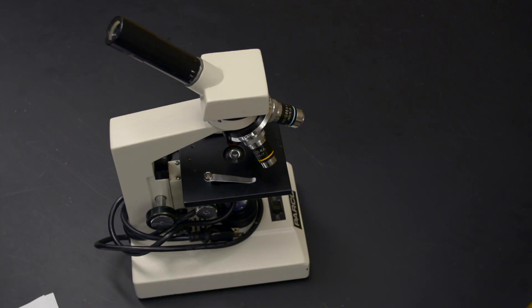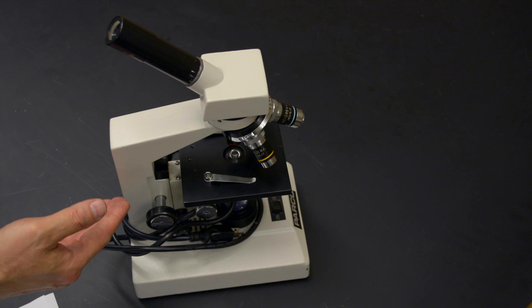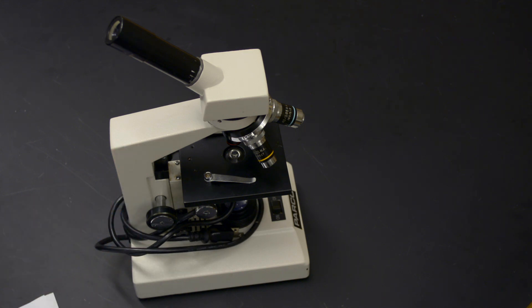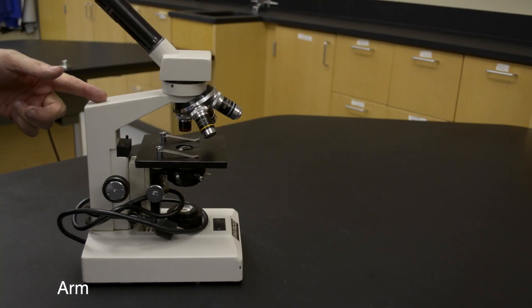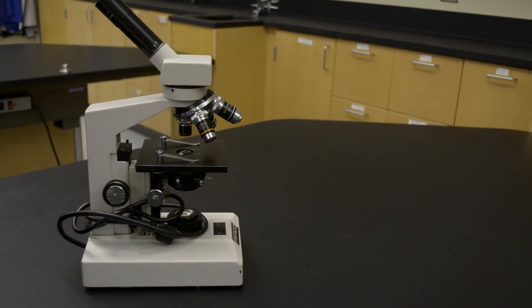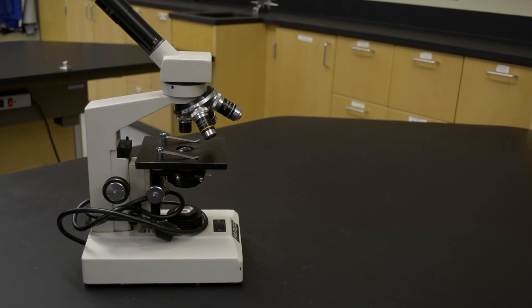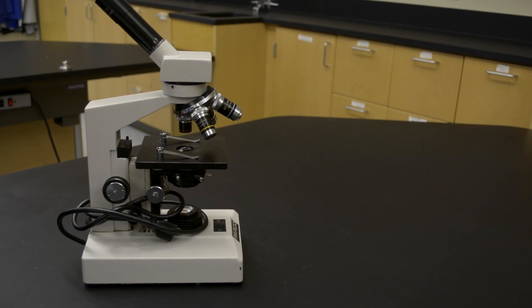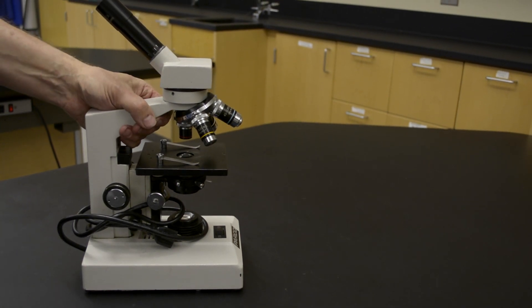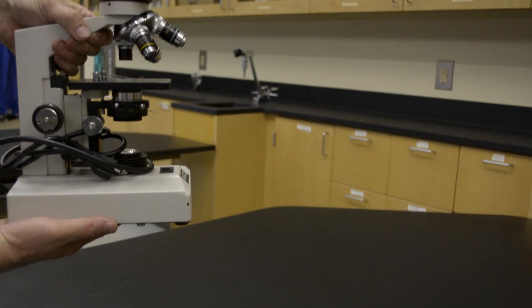In order to know how to use the microscope properly, you need to be familiar with its parts. The arm and base of the microscope are used whenever you need to transport it. When moving it, you would grasp the arm with one hand and support the base with your other hand.